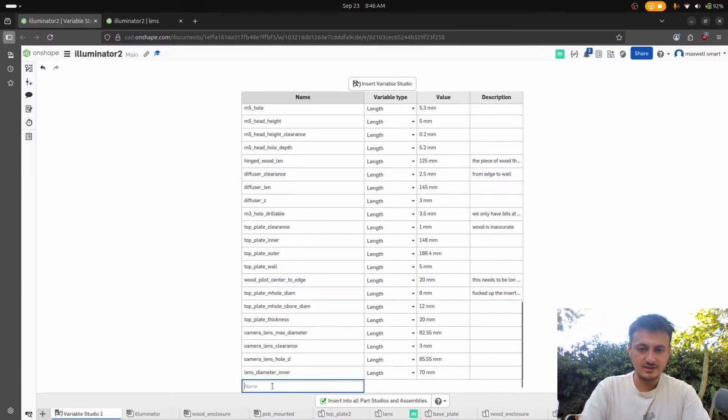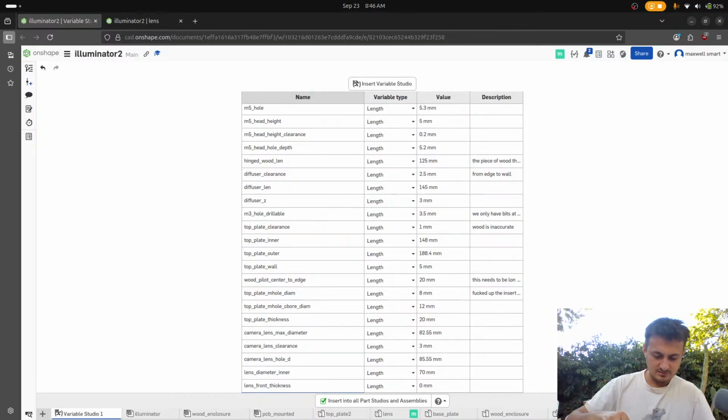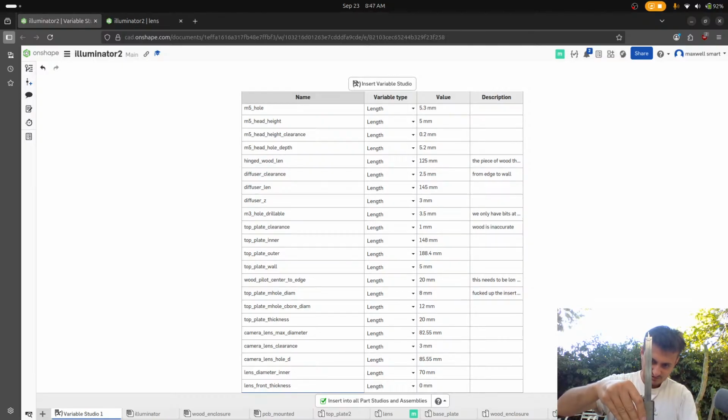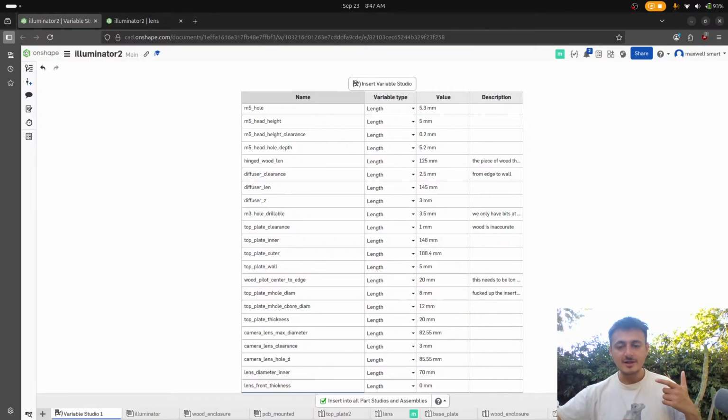So then what we want to do is the lens front thickness, and this is basically the thickness of the 80 millimeter part. Oh wait, but without the lens cap, right? Oh my god, this is scary. It's 13. Let's test it one more time. Actually, you know what? Just because I want to be extra, I'm gonna go get my micrometer. Bro, I got a micrometer. I just love the fact that I can say that I own a micrometer. You're looking at a guy that cares about precision.